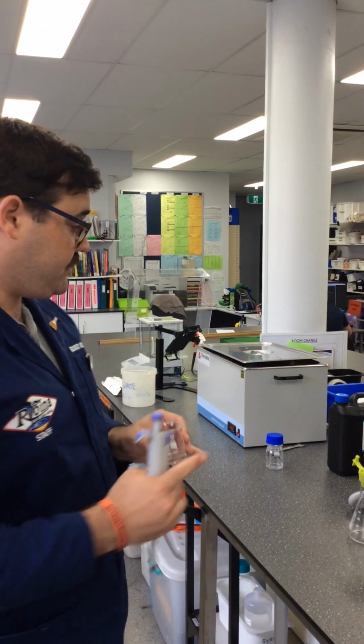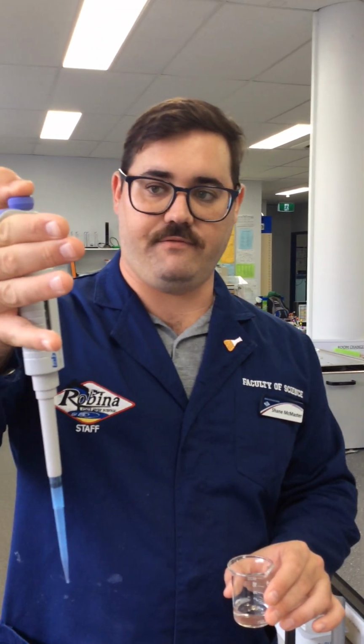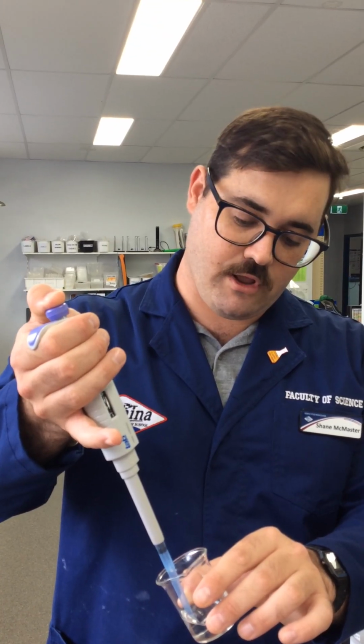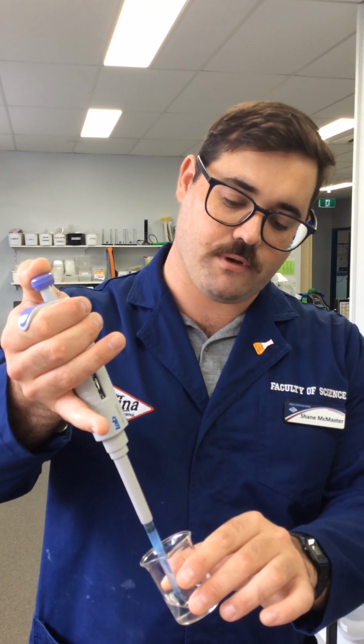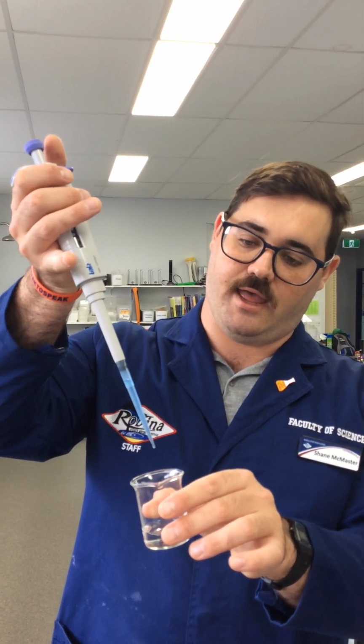Okay, I took a little sample of our Catalase before I put it into the water bath there. And I have actually checked the temperature of this and the hydrogen peroxide. The lab temperature at the moment is 25 degrees, and these have gotten up to 25 degrees. So I've acclimated them. Now this is set to 1,000 microliters, which is 1 mil. So I'm just going to push that down until I feel the first stop. I'm going to put it into my solution and slowly release it up to the top. And that's going to put 1 mil of our solution in there.